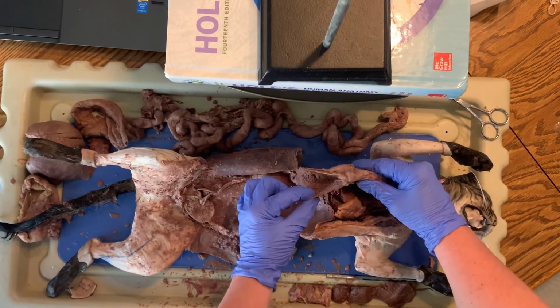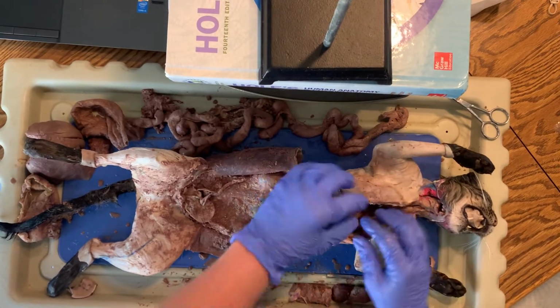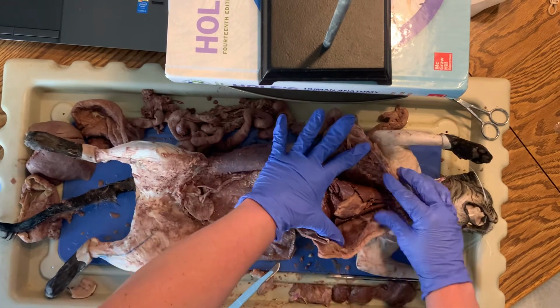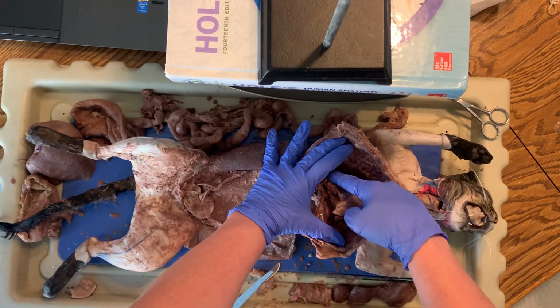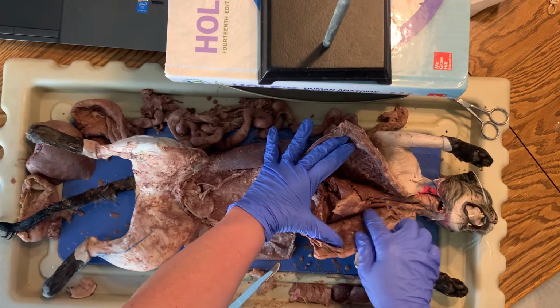That is your diaphragm muscle, separating your thoracic from your abdominal pelvic cavity. And then when we open it up, I cut through the ribs and the sternum to expose the whole thoracic cavity. And right there under all that fat is the heart. Here is the cat's right lungs, all the lobes. Here is the cat's left lobes of its lung.